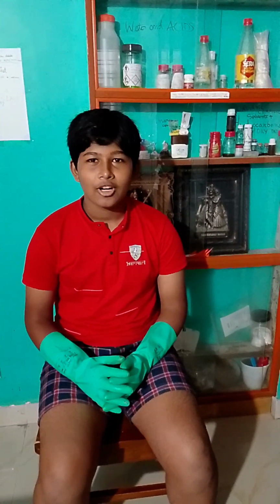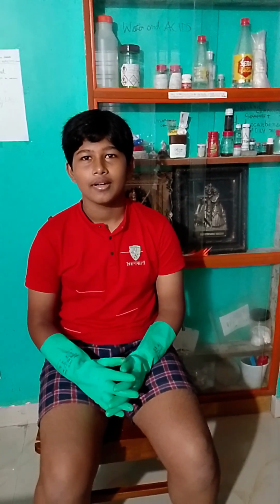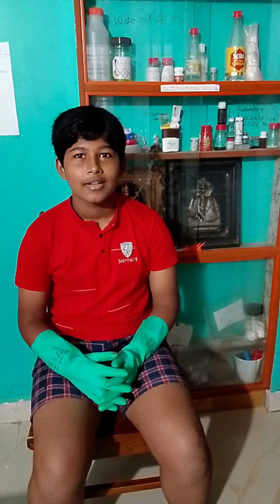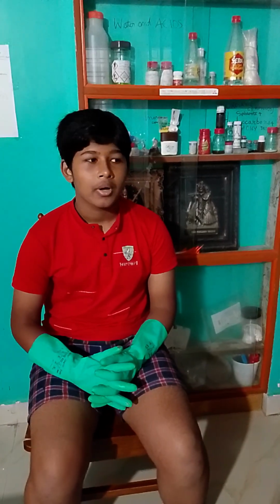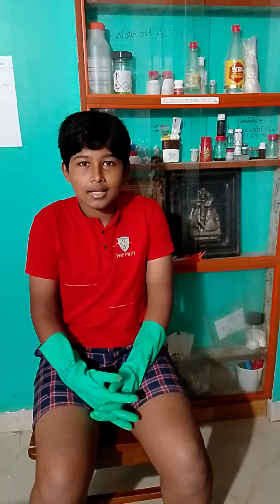Okay, so I thought about this failure that we encountered in the previous part of this video. I couldn't separate the copper oxalate from sulfuric acid. So I thought about a process which I talked about in the previous video. I didn't have time to do sedimentation at that moment, but now I waited for like 5 days, it will be 3 days, 3 to 4 days.